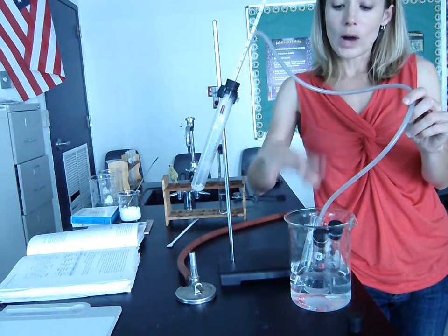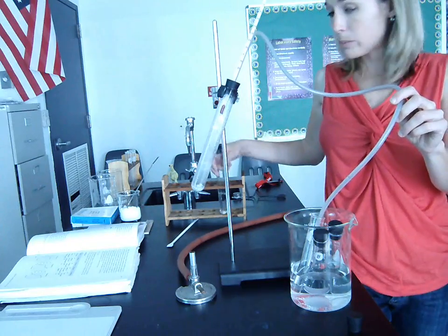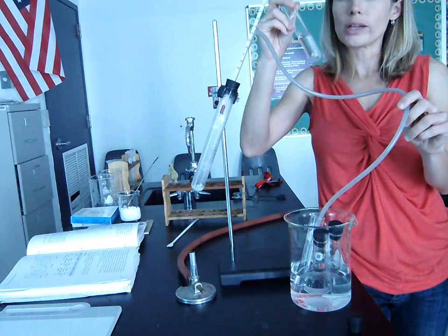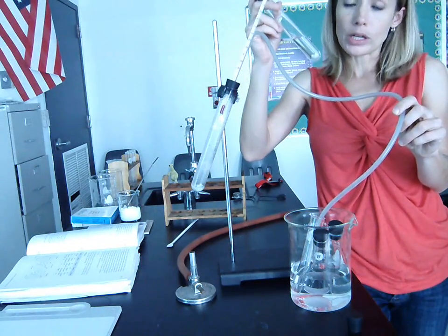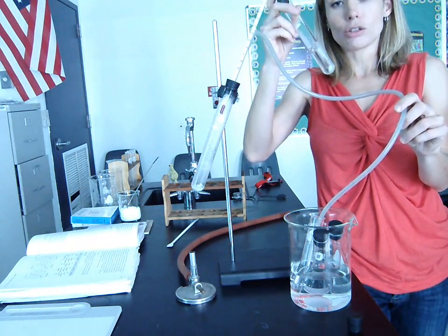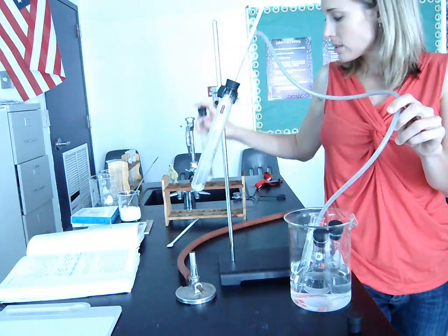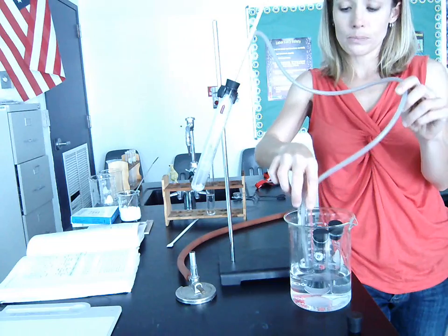So while it stays at 80, we're collecting the liquid from our mixture whose boiling point is 80 degrees, because only that part of the mixture is boiling off. The part of the mixture that boils at 100 isn't evaporating yet and turning into a gas because it hasn't reached its boiling point. So at 80 degrees, the only part of the mixture that's actually boiling is the part whose boiling point is 80 degrees. So that's the part that's going to boil off and then condense over here.